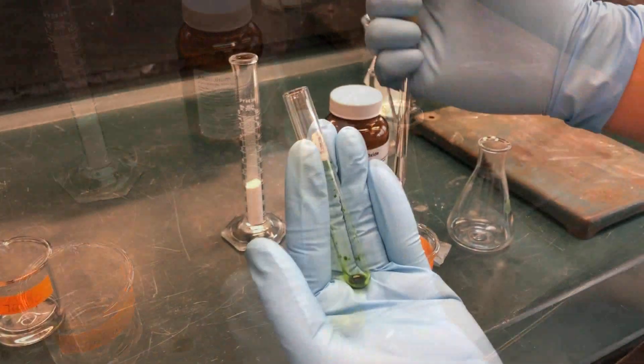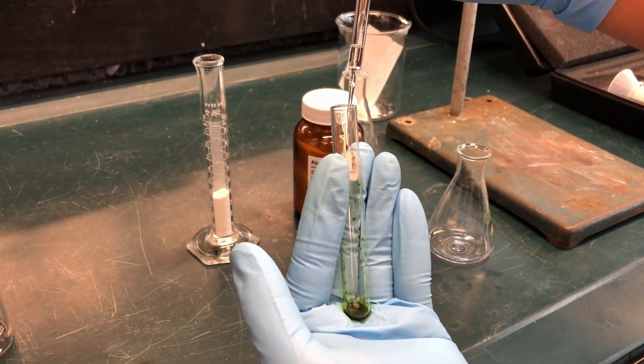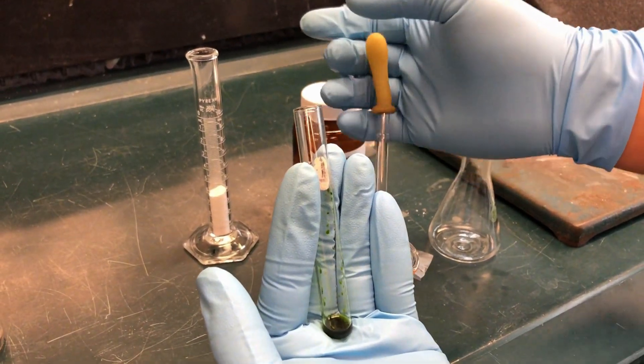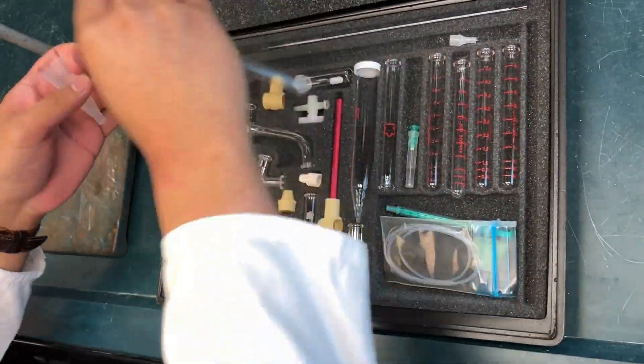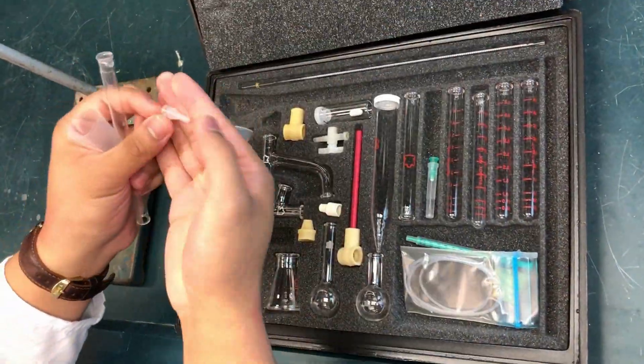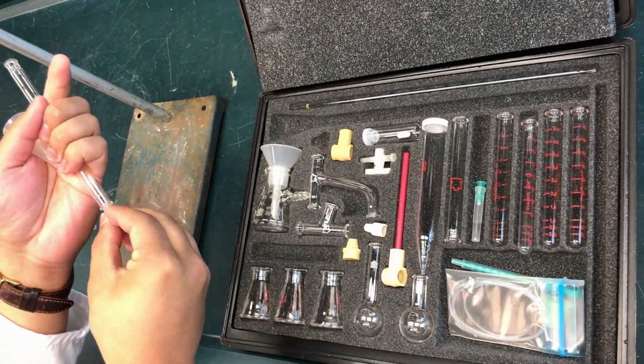You will need to rehydrate your pigment using about 0.5 milliliters of petroleum ether. Prepare the column using a funnel, chromatography column, and stopcock from the microscale kit.